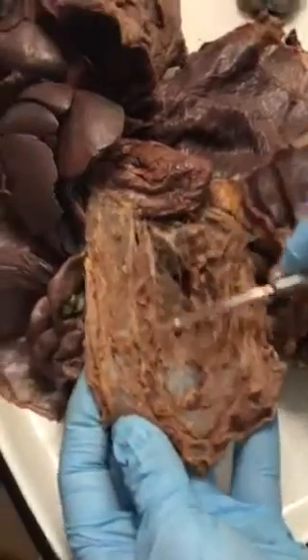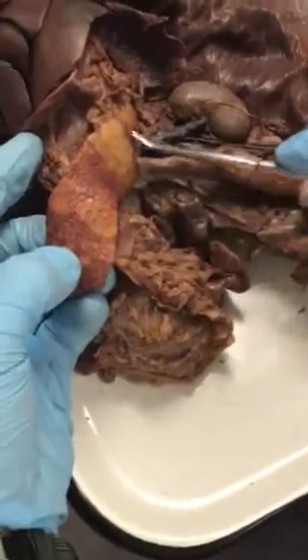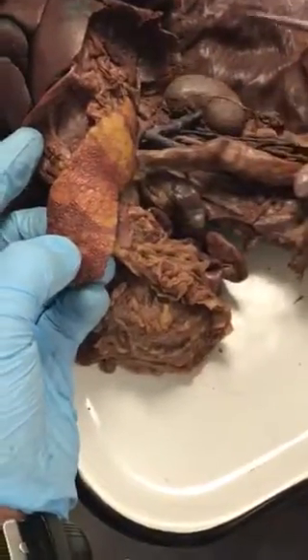And so going back, right here we've got our greater omentum, which is all this membrane and fatty looking stuff. That looks like a scrotum. And then on the other side of our greater omentum, we get our spleen right here, which kind of looks like a dog tongue. Of course, you see the kidney right there.